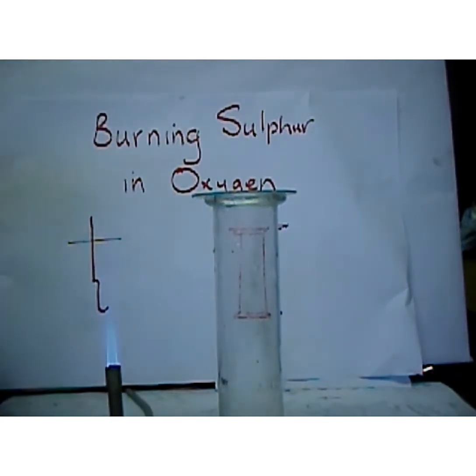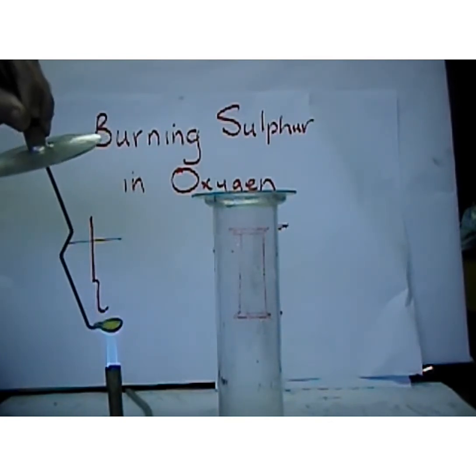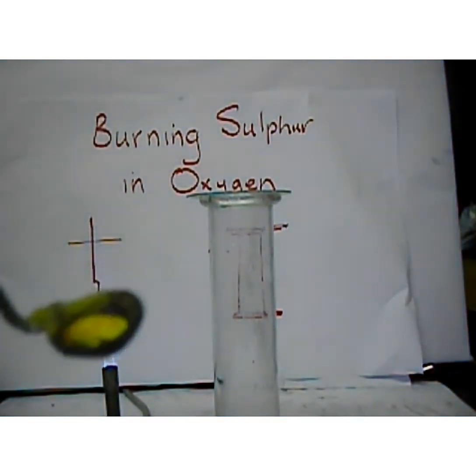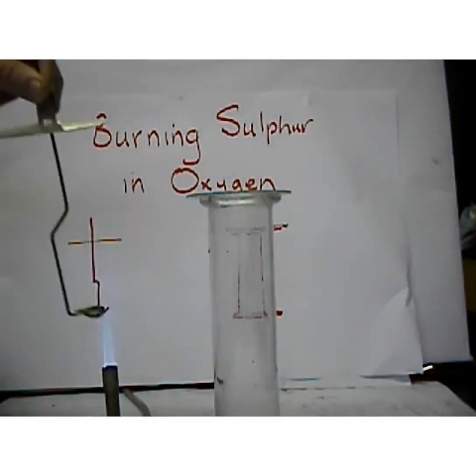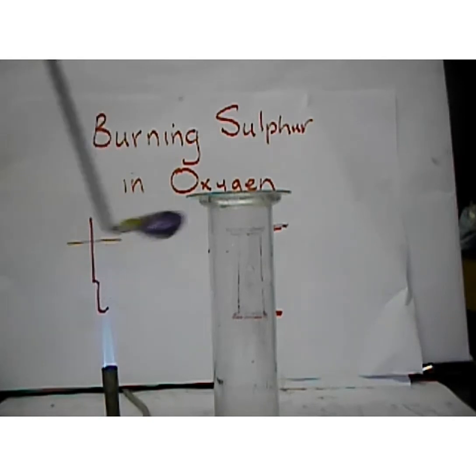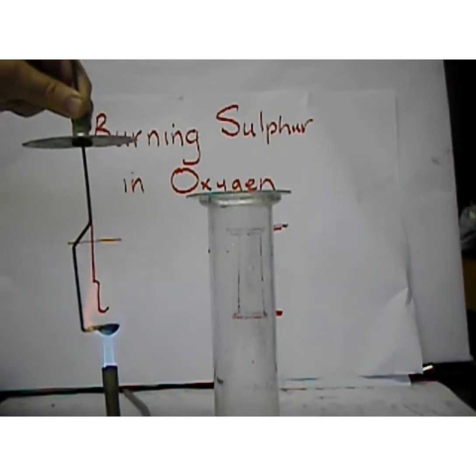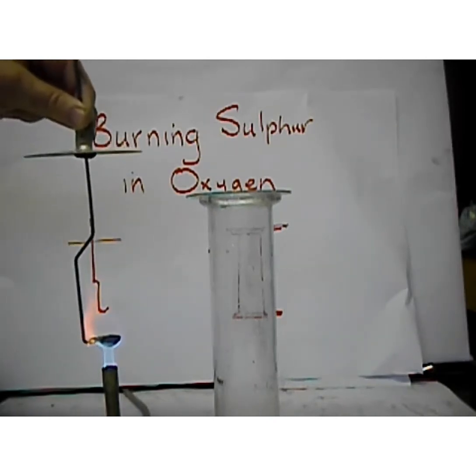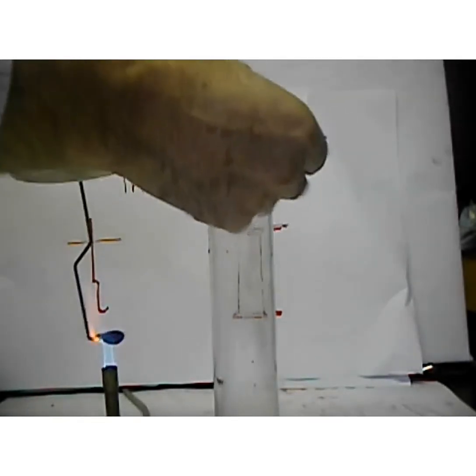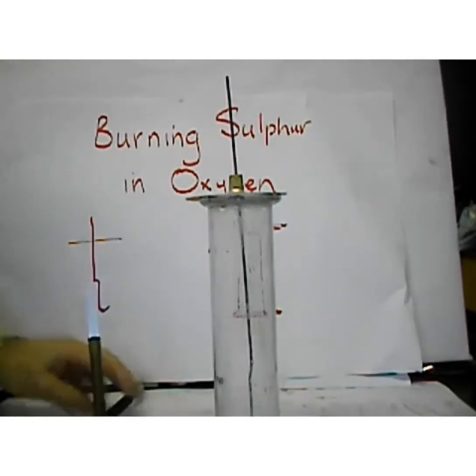So let's see if we can pick this up in detail. The sulfur begins to melt right away, and you can see on the surface it's already beginning to turn a ruby red colour. So I continue to melt the sulfur. Doesn't take much heat, there it's all melted, and that yellow powder has turned into a red coloured liquid. I now ignite the vapour. It's now beginning to vaporise. I ignite the vapour and I lower it into the gas jar of pure oxygen, and there you see a beautiful blue flame.